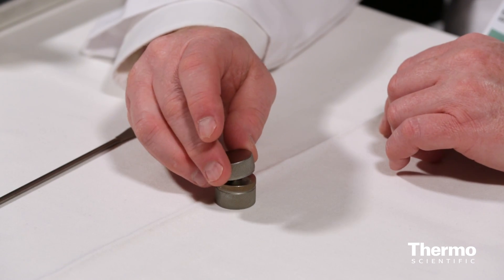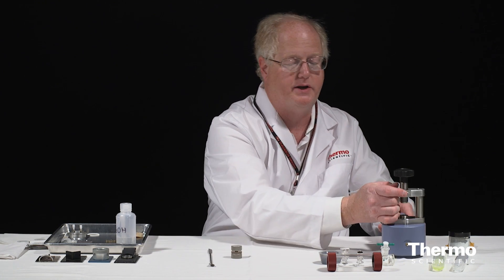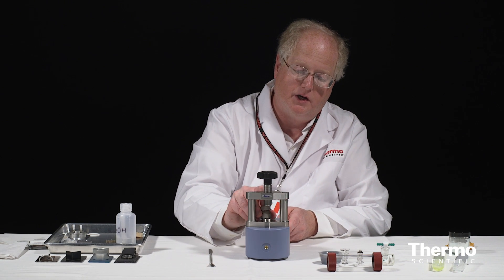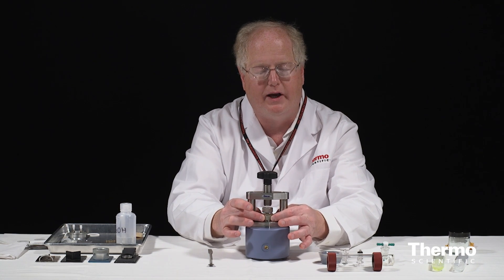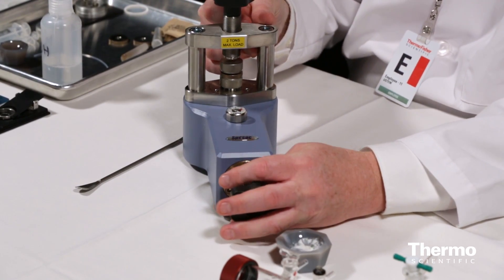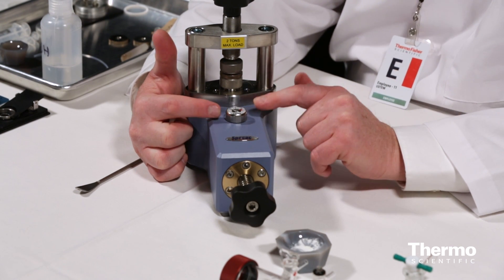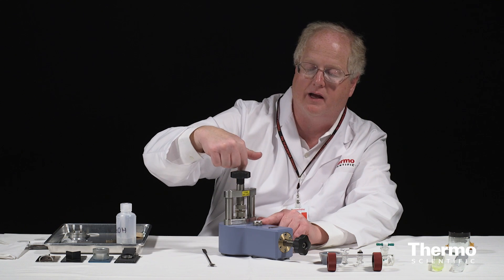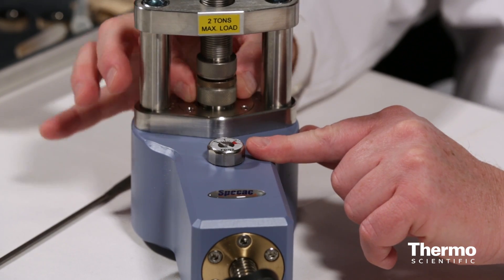So then I'm going to capture it in there with my hammer on top. Now my unit is assembled and ready for insertion. I'll bring the press over — this is what's called a mini press; we commercially sell these. You just slide the sample on and the cup portion will line itself up so that it can't move off the lower portion of the press. You can see right here there is a gauge that goes up to two tons, and that gauge is what's going to tell me how much pressure I've applied. I'll bring down the retaining portion, which establishes firm contact so the whole pellet press assembly is held in place.